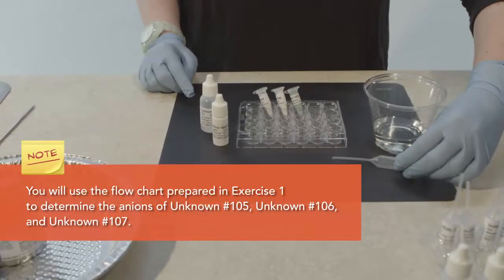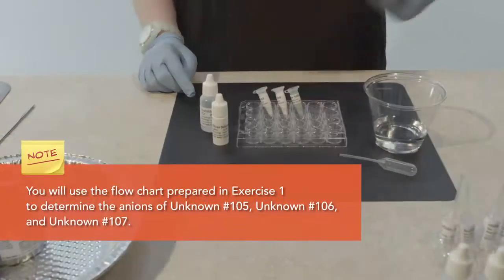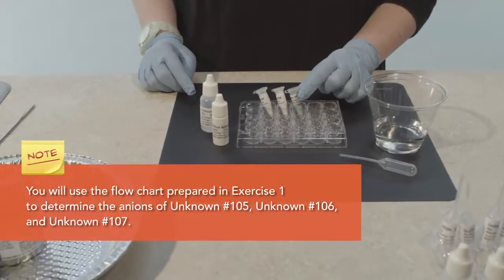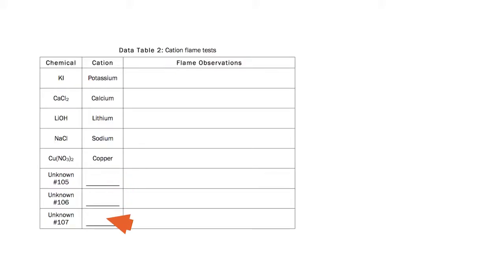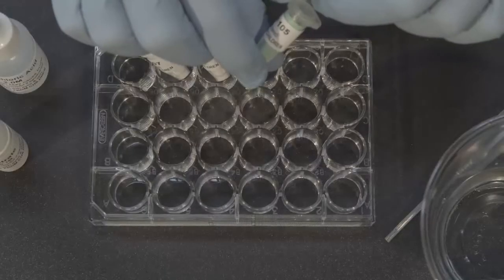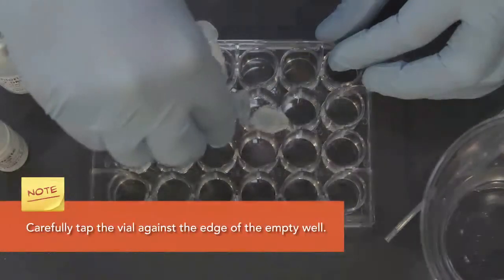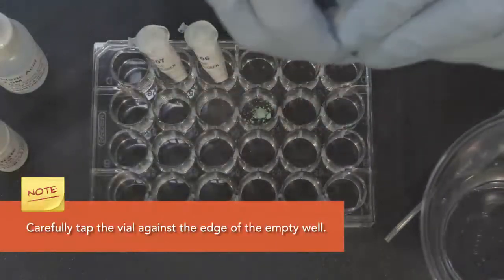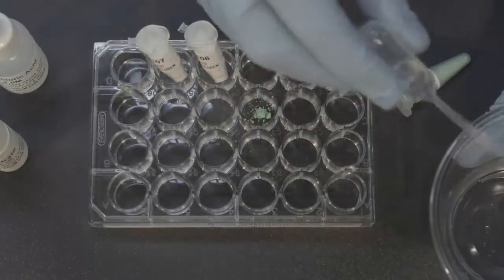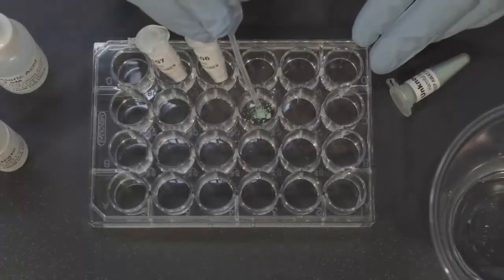From this, you will be able to identify the name of the chemical, both anion and cation, of these 3 unknowns. Use the results in Data Table 2 to fill in the identification of the cation for unknown number 105, unknown number 106, and unknown number 107 in Data Table 3. Place a pea-sized amount of unknown number 105 into an empty well of the well plate. Use the empty pipette to add 1 drop of distilled water directly onto the chemical.